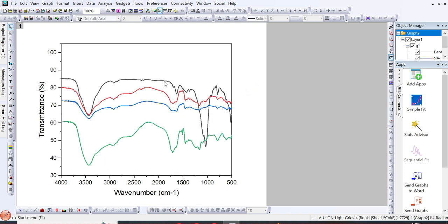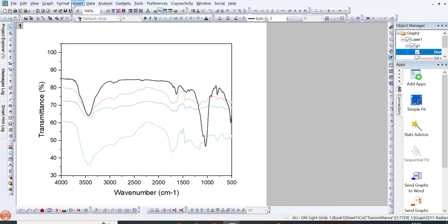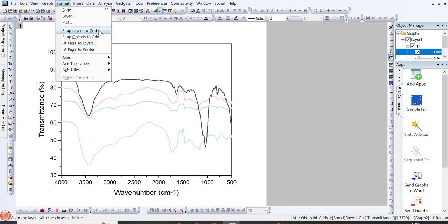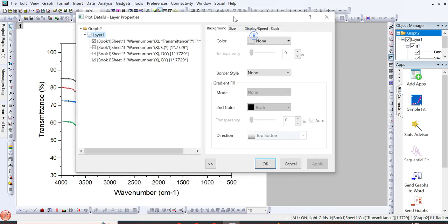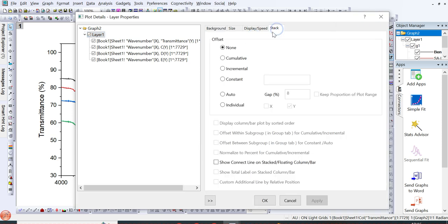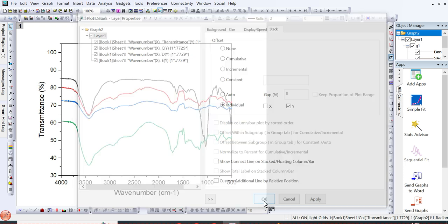For this, you just need to click on any of the lines in the graph, and then you can go to the top corner to Format, and when you click on Format, this menu bar will open, and here you can click on Layer. Once you click on Layer, this box will appear, and from here you can go to Stack. From Stack, you can see an option of Individual, so you need to click on Individual. It means you can move each line up and down individually without disturbing, adjusting or removing other lines or data sets. It was previously selected as None, so we need to select Individual, and then you just need to click on OK.